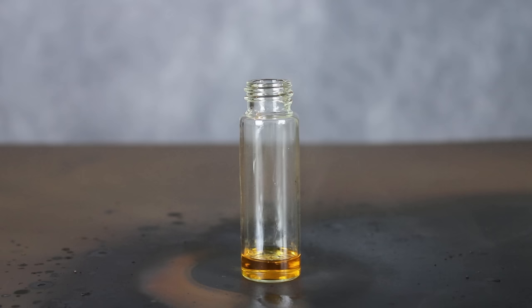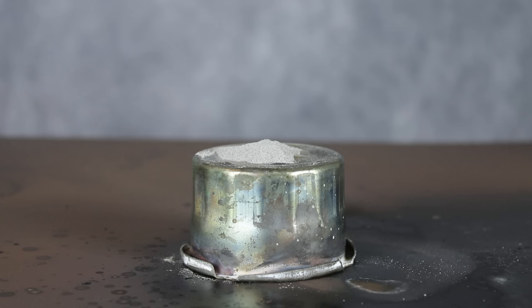This reaction honestly brings into question how the chlorosulfonic acid interacts with acetone by itself, so I tried that next and got a pretty neat result. I'm not really sure about the red liquid's chemical makeup, but whatever it is, it seemed fairly water insoluble and it smelled sweet and solvent-like, kind of like the silly string you get at kids' parties.